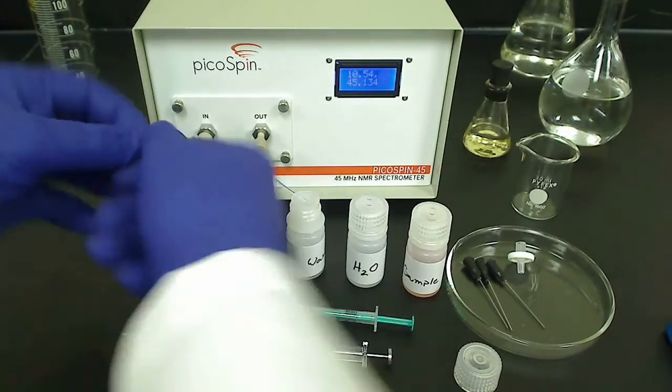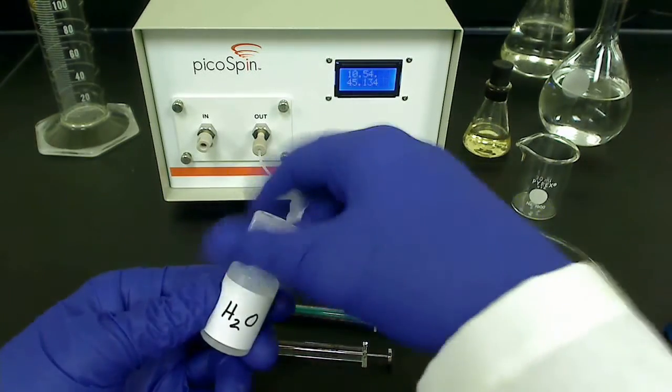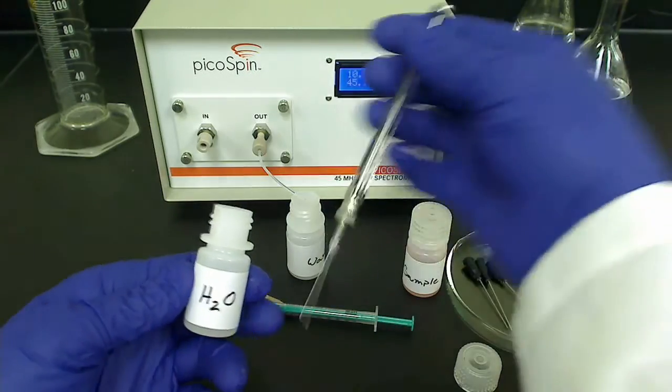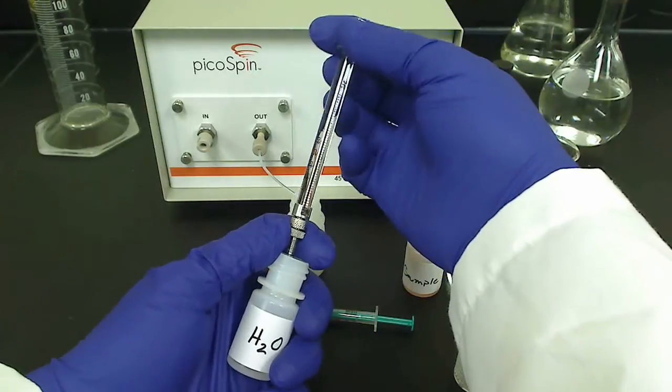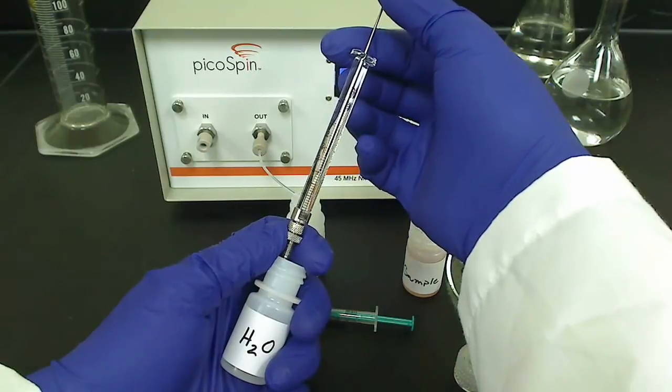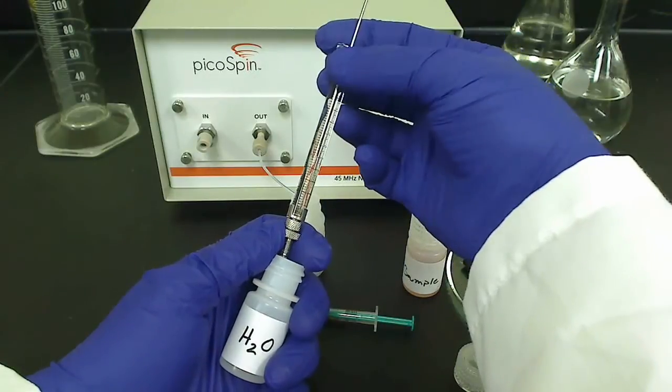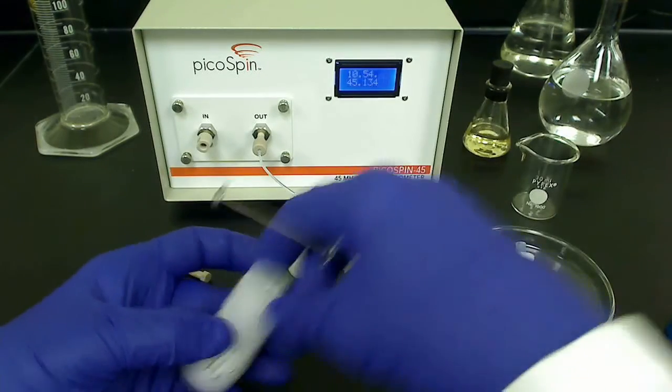Since I'm using a 100 microliter syringe, I'll withdraw approximately 40 to 50 microliters of sample. The dead volume of a gas-tight syringe is considerably smaller, and so the air bubble behind the liquid will be much smaller. This air bubble can be eliminated nearly completely by carefully withdrawing sample. To completely displace the sample resident in the cartridge, one needs to inject approximately 25 microliters of sample.